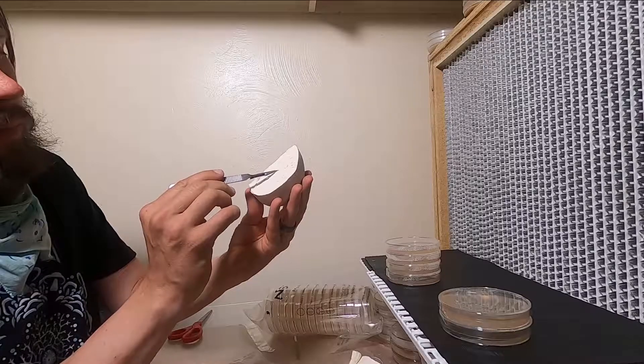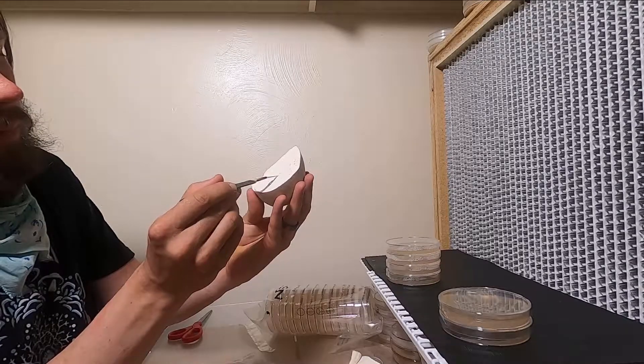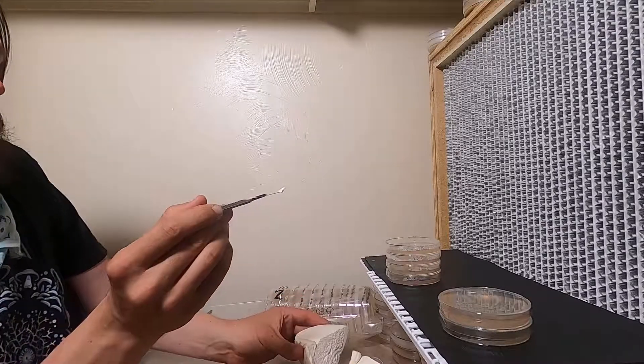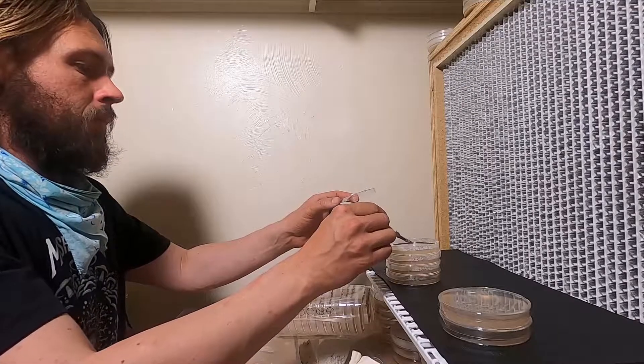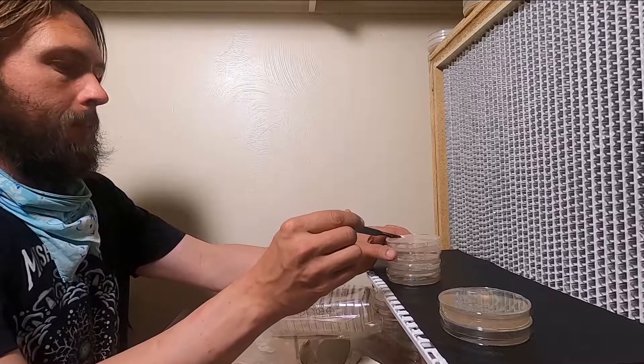So I'm going to cut out a little pyramid. And the tissue is very soft, so I'm going to try something I've never done with a clone before. I'll put it on my first plate and then just trim off a little piece. You'll see it here. I'm trying to cut it in half and take part of it. So I left some behind.